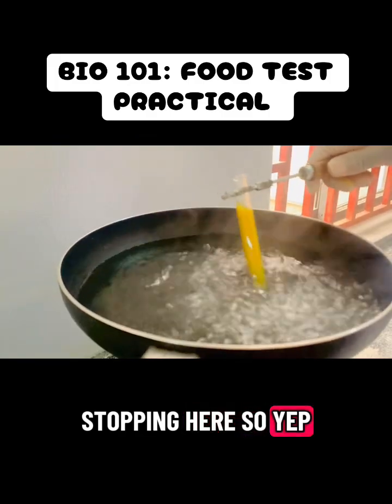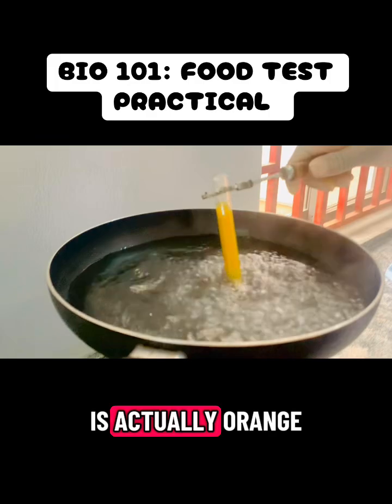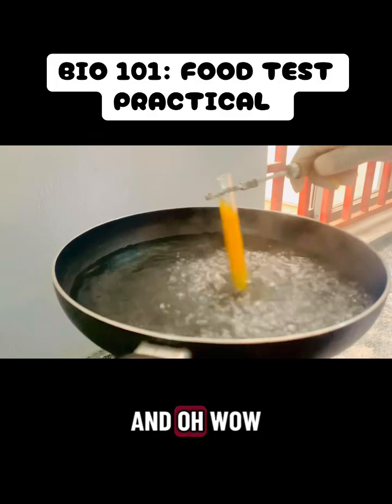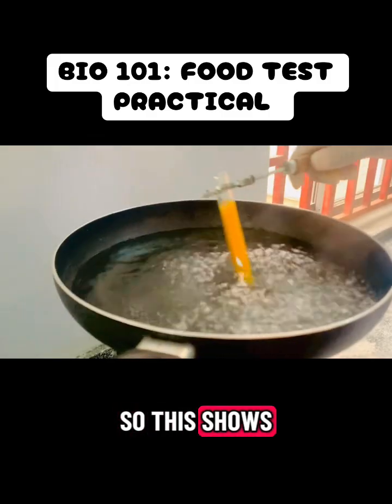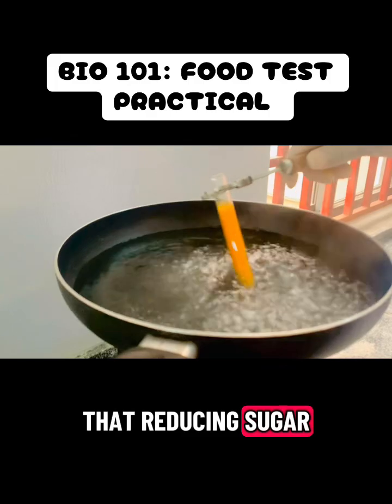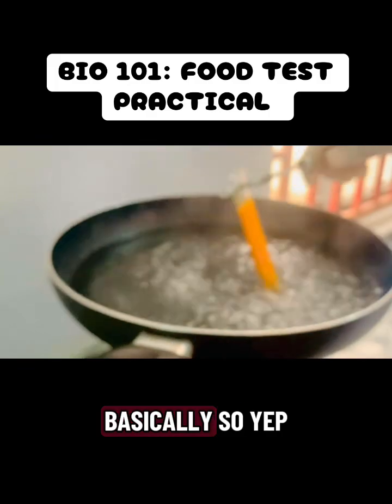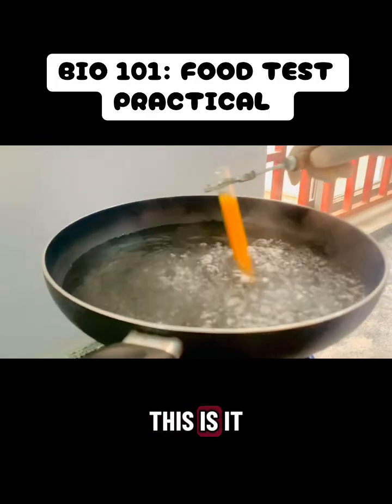So, yep, this is what we have. This is actually orange. From orange now, oh, it's becoming thicker. And oh, wow. So this shows that reducing sugar is present. Yes, sugar is present basically. So yep, this is it.